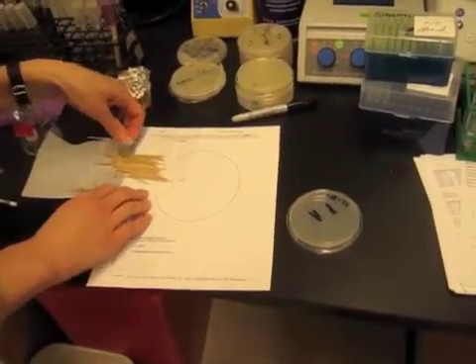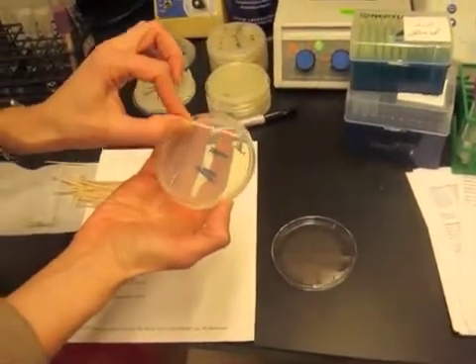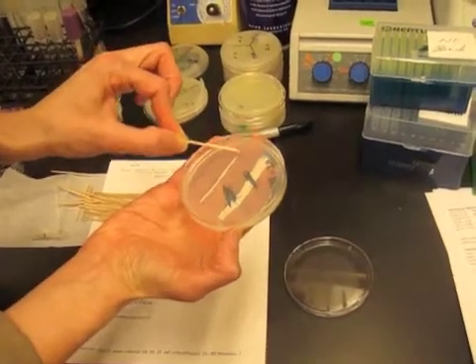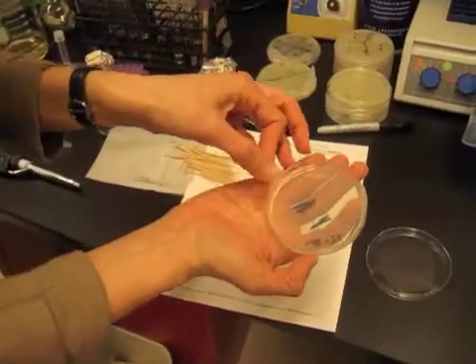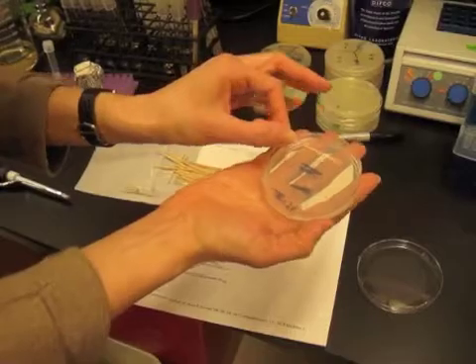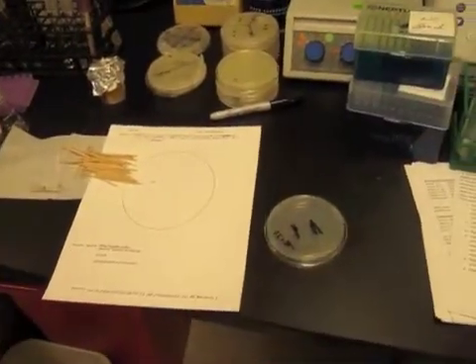I'll take a second toothpick that's also sterile, and streak that small dab of E. coli across the agar surface. And then I'll take a third toothpick and spread out the very last bit of cells for single colonies, and we'll grow that at 37 degrees overnight.